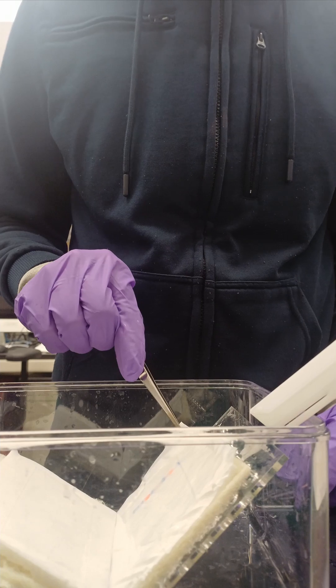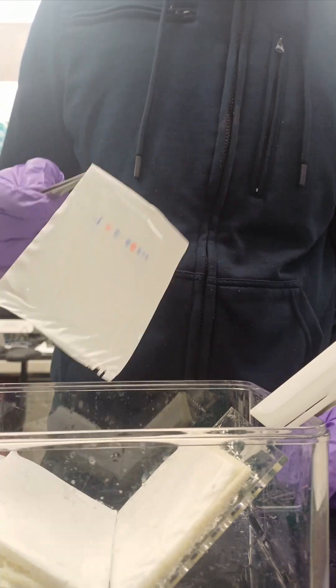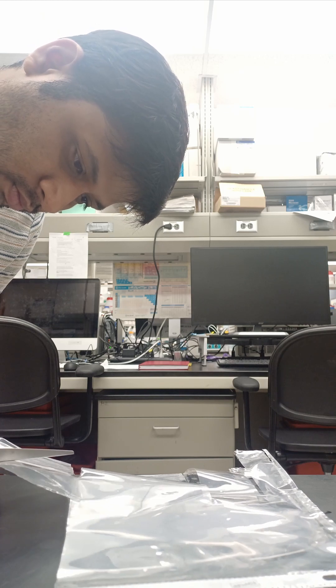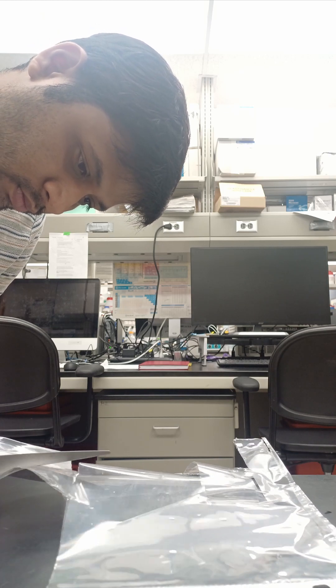Next day we check the pre-stained marker. If it's visible on the membrane, the transfer has worked. I trim the membrane by placing it between a sheet and mark the ladder using a ballpoint pen. This helps during imaging.